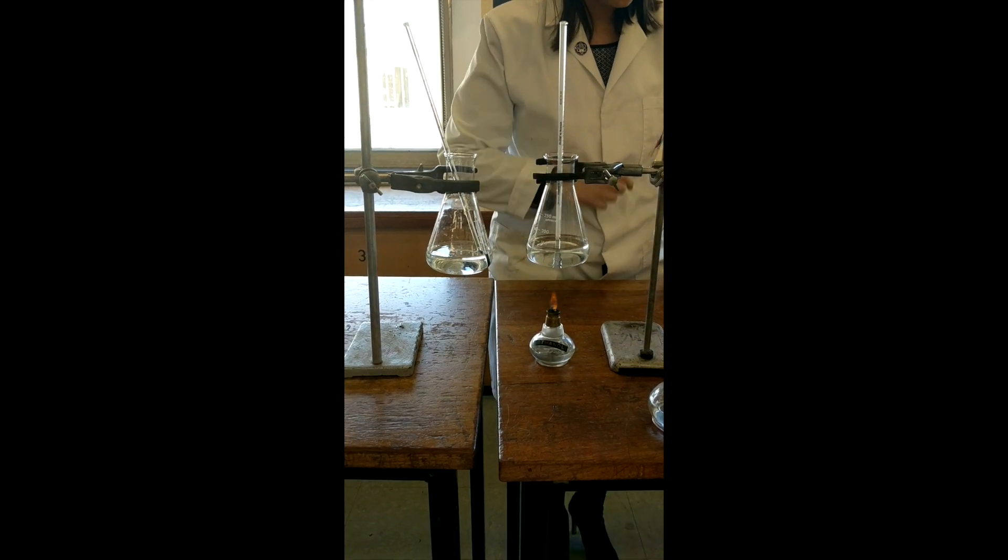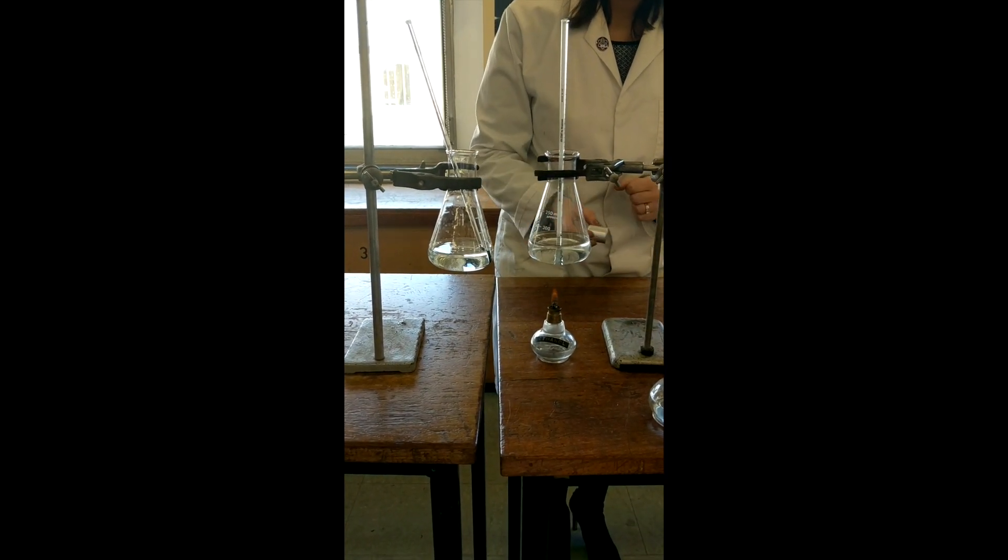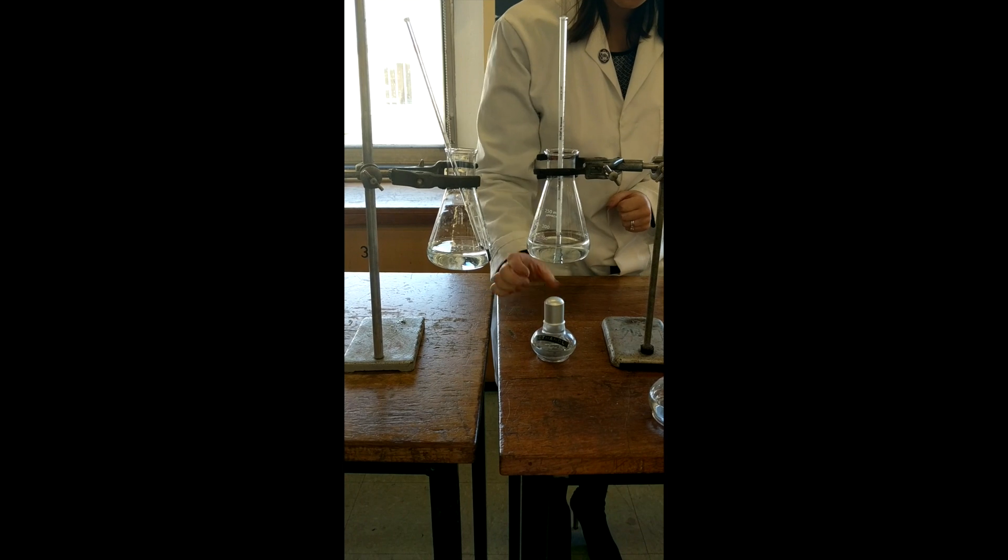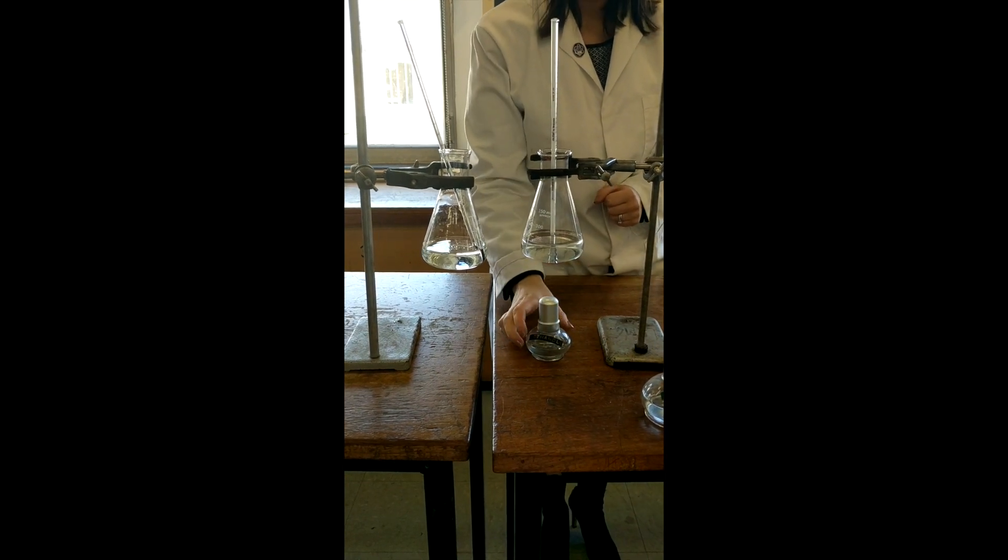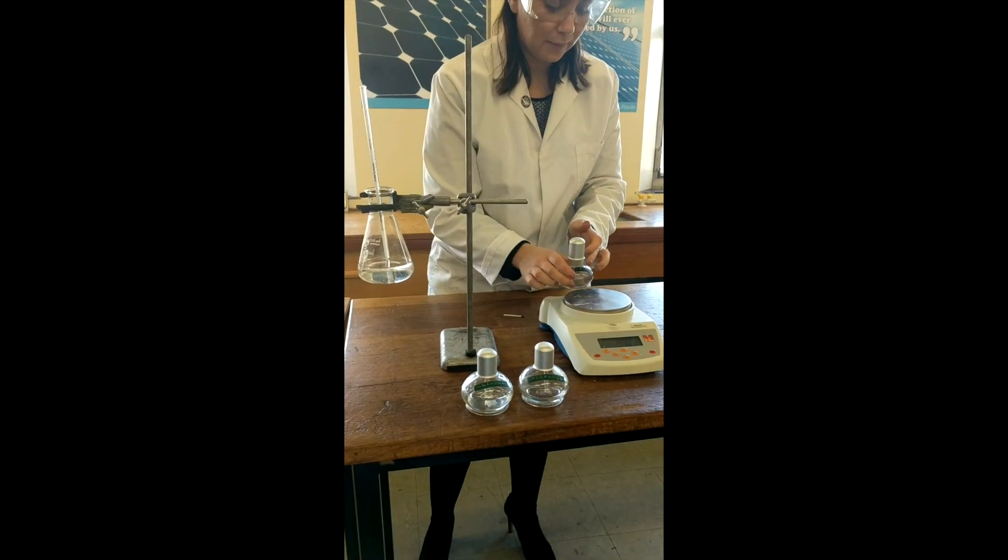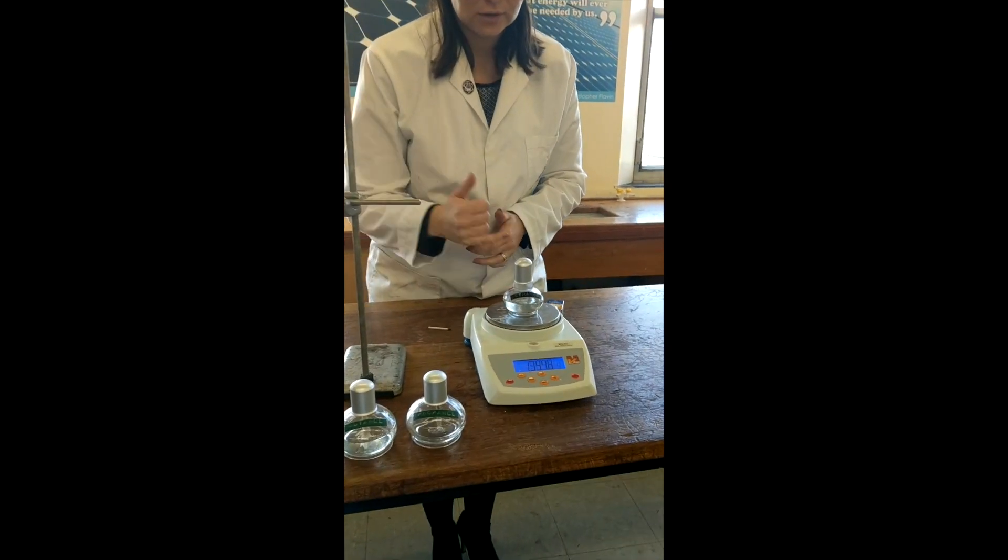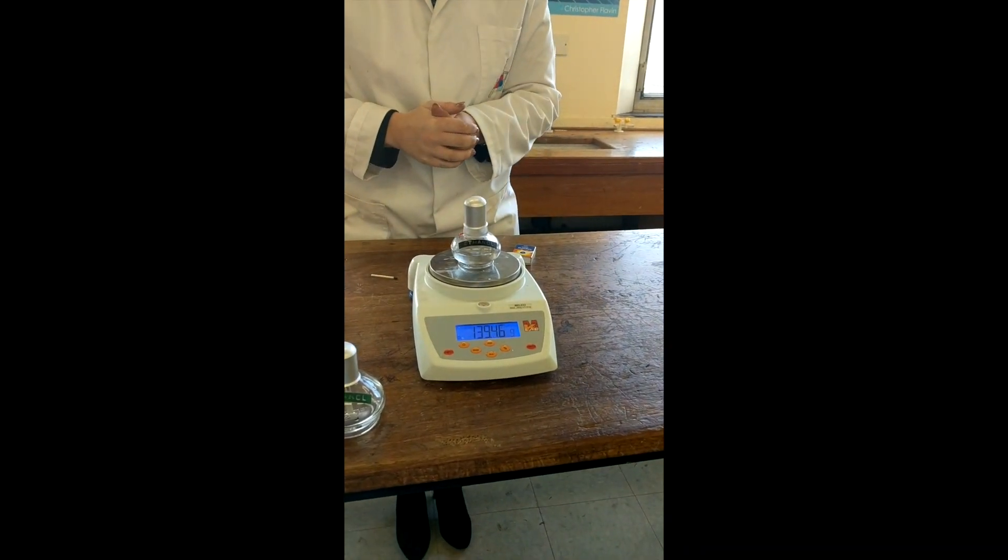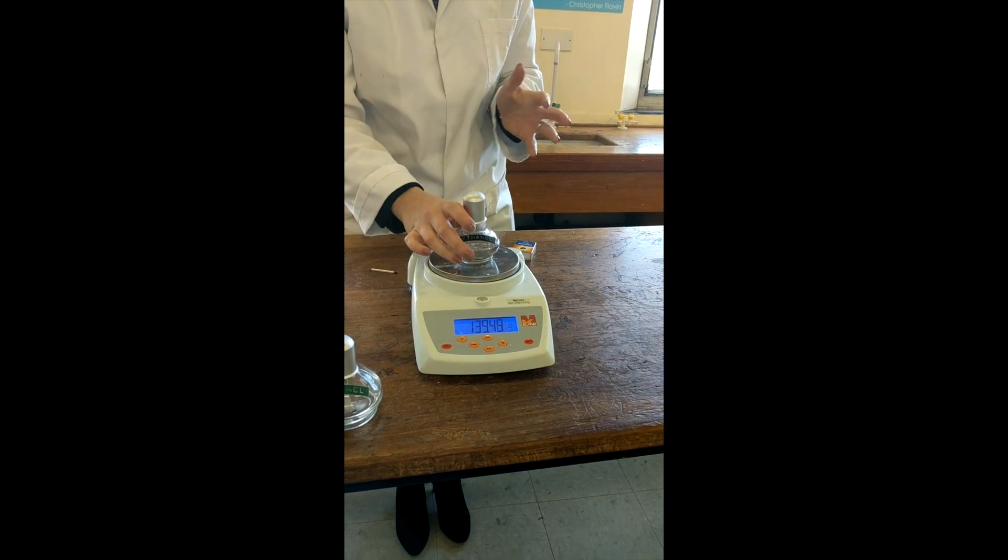Okay, so I'm going to just whiz through that a minute. Imagine that's now on 60. We'll put the lid onto the spirit burner, record the temperature on there at 60, and we would re-weigh the fuel. And you will see that it should be a lower number. You'd record that in your table.